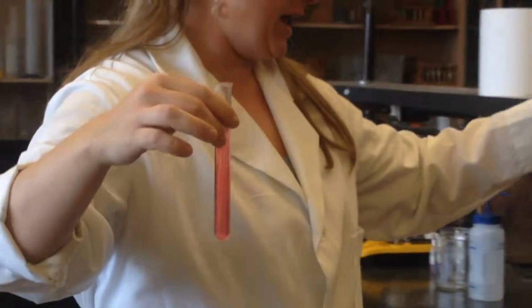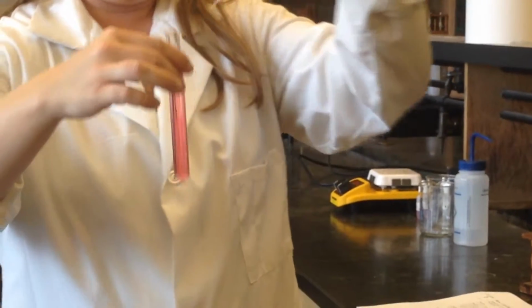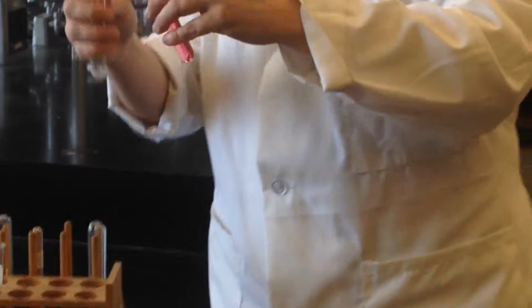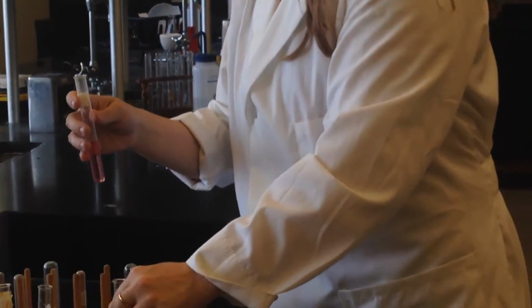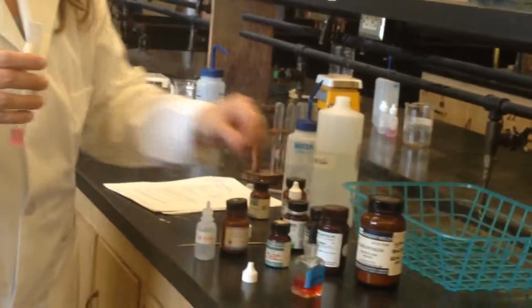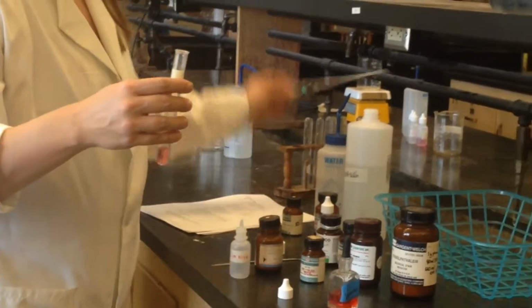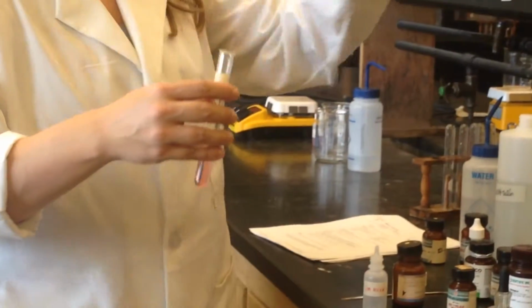I added a lot of acid in there, so I'm kind of running out of room in my test tube. But, okay, let's put a little bit in another test tube and see, because I don't have any more room in this one. There we go. Okay, let's see. So we have our solution here, which is a smaller one. And then we're going to add, what was I adding? Base. Here we go. Okay, so we keep adding base. Keep adding base.